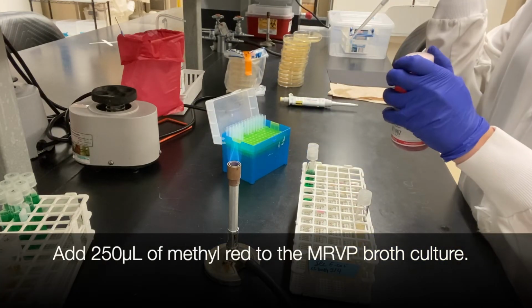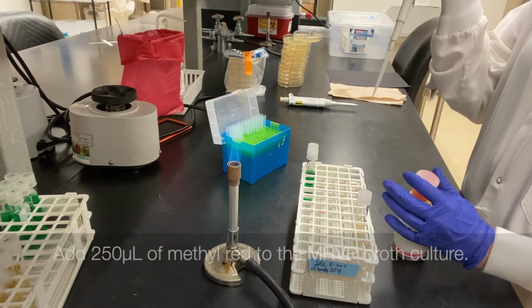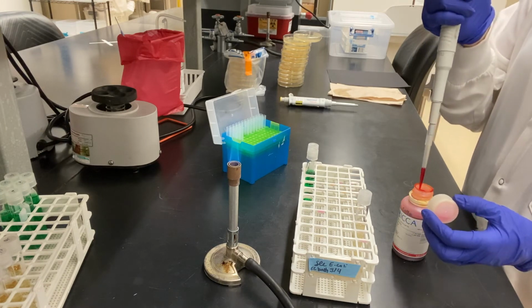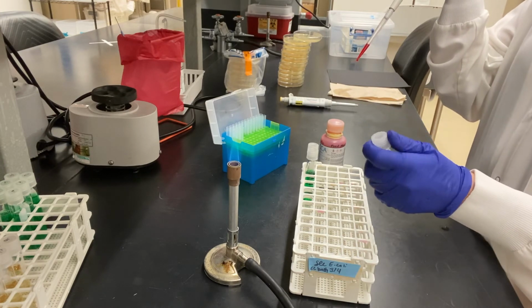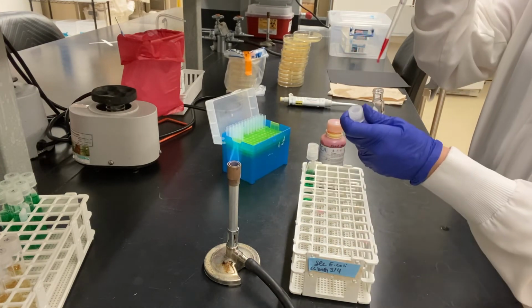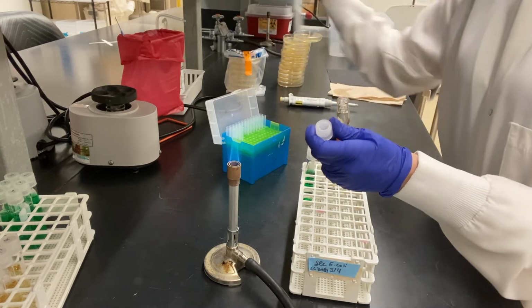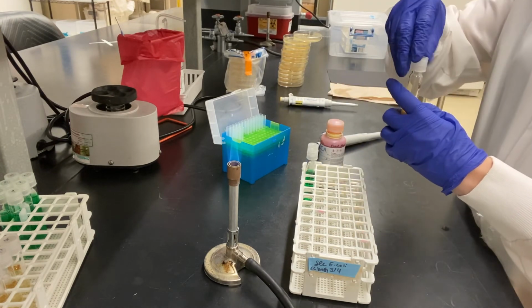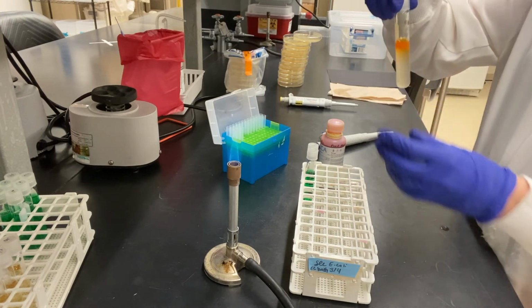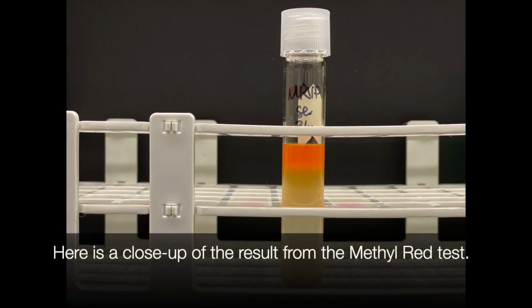Add 250 microliters of methyl red to the MRVP broth culture. Here is a close-up of the result from the methyl red test.